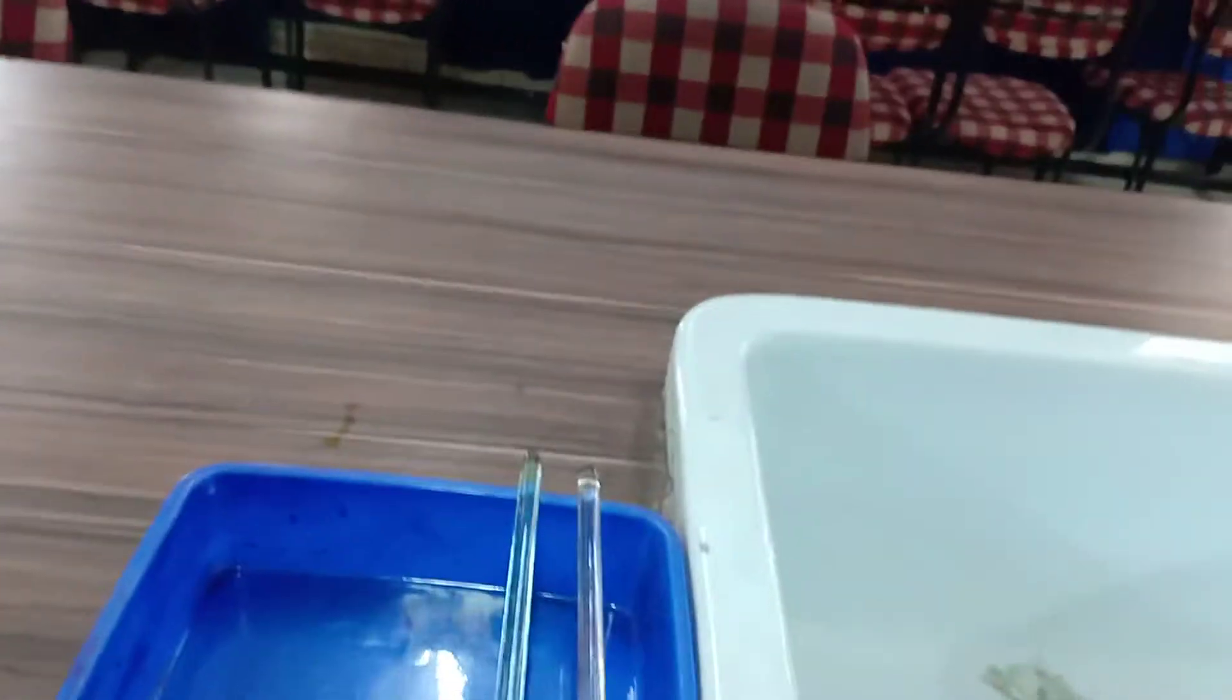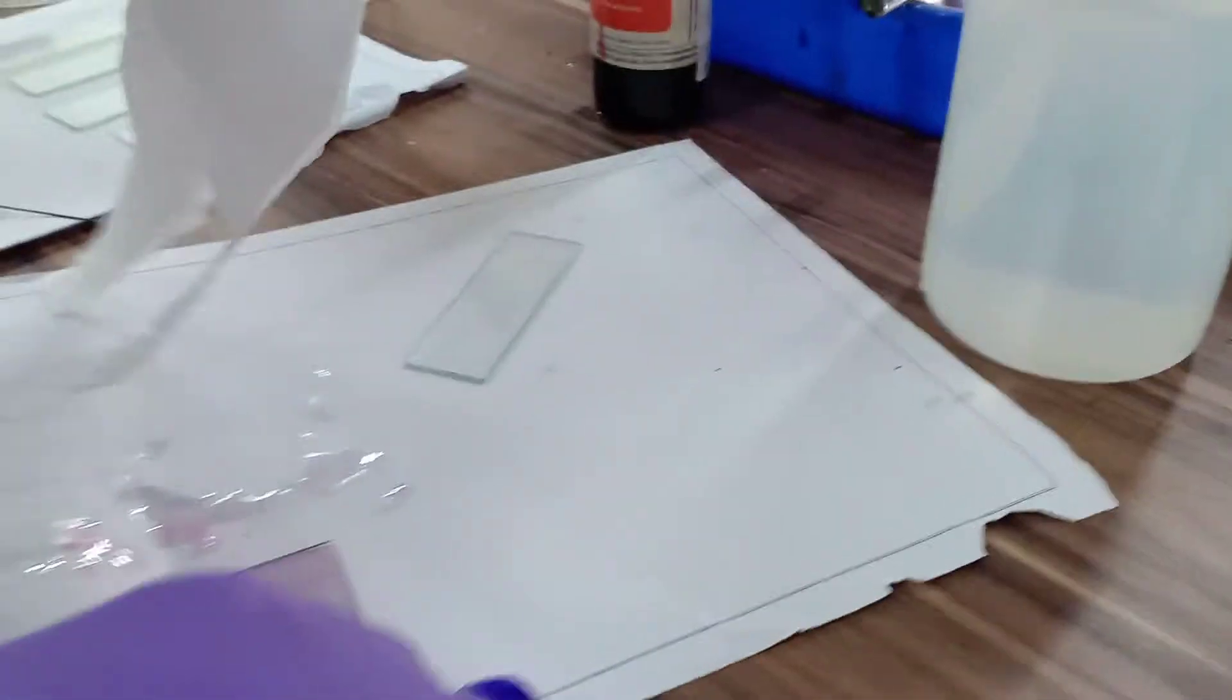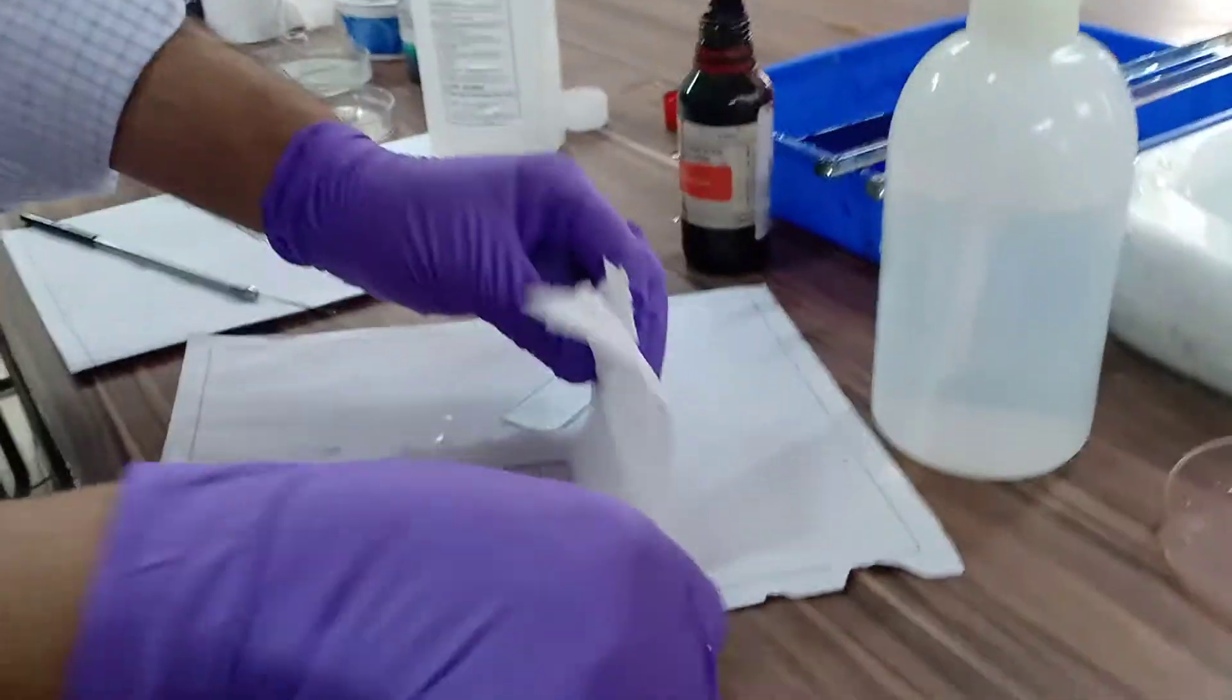Now it is ready for absorbing. Either you take a blotting paper or simple paper. I am using tissue paper instead of blotting paper, but you have to use blotting paper.